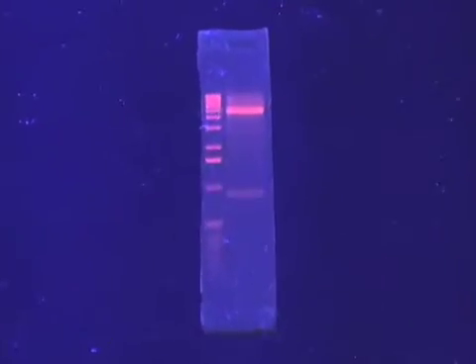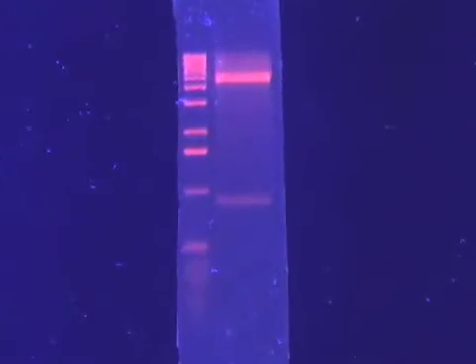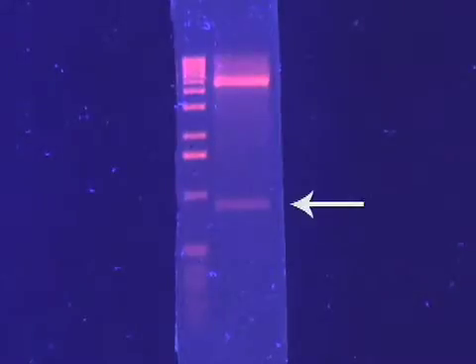The DNA sample is first visualized by ethidium bromide stained agarose gel electrophoresis in order to visualize and identify the desired fragment to be purified. Electrophoresis should proceed until fragments are well separated and their size can be precisely determined.